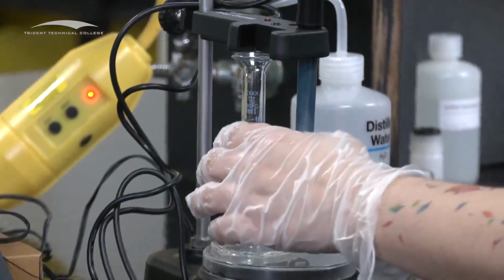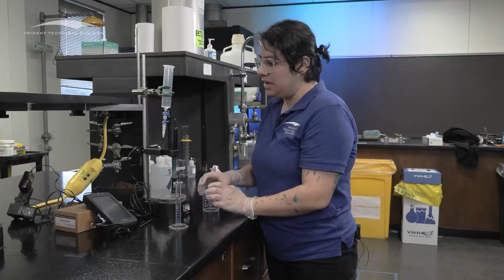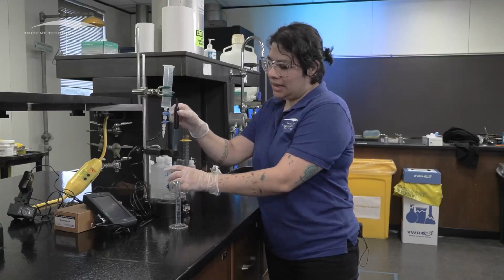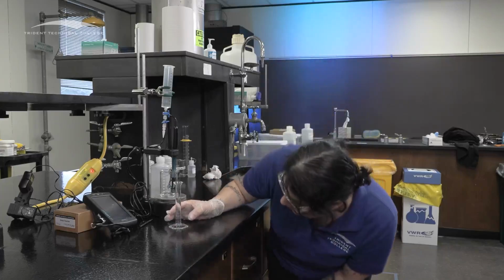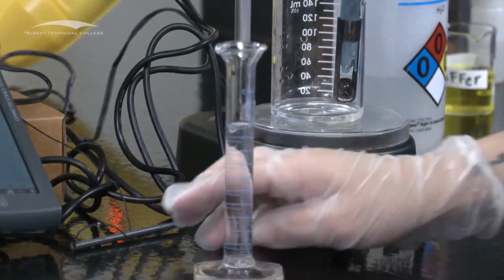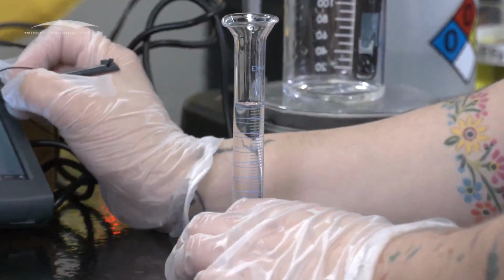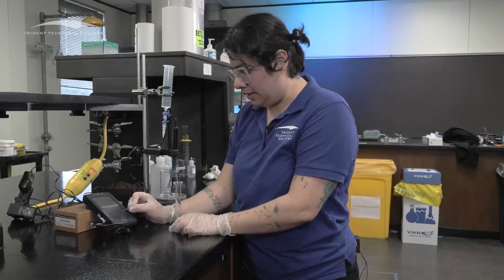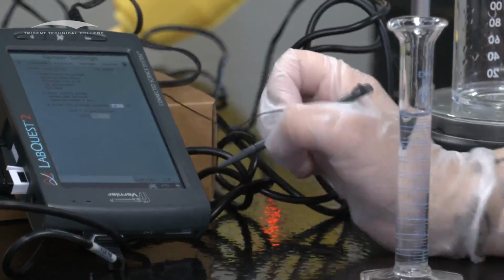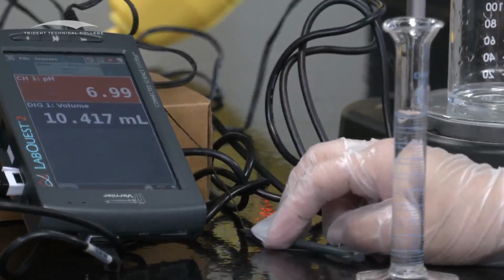So what I'm gonna do is take this down. And you wanna read, if you're a little bit below 10, that's okay. Whatever volume you're at is whatever volume you're gonna record. And this one, actually a 9.8. So I'm gonna go in and press 9.8. Whatever volume you read is whatever volume you input, and then OK.